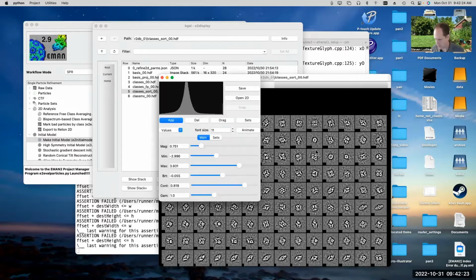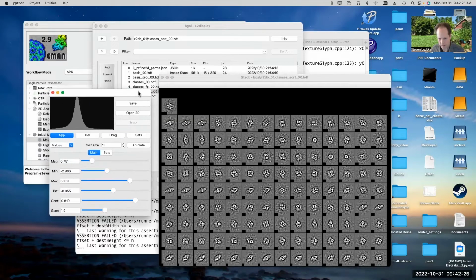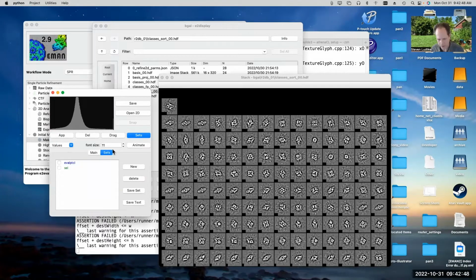So the way I do that is I middle click, and if you want to include most of the class averages and just exclude a few, you can use the del button, and you can delete the ones that you don't want, and then you can save everything that's left. Alternatively, if there are fewer that you want to keep than you want to get rid of, then we use the sets interface.